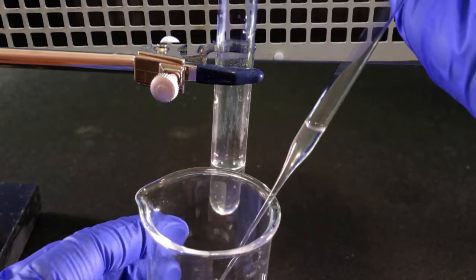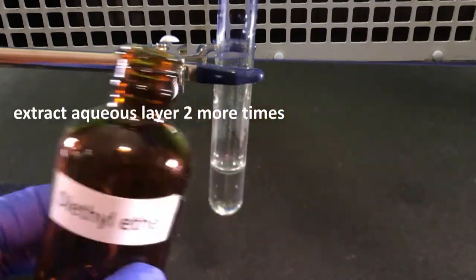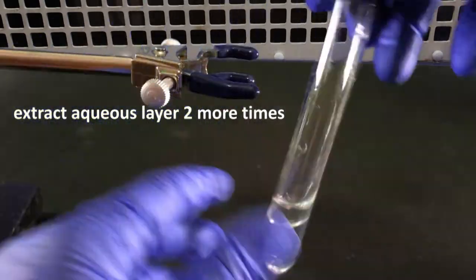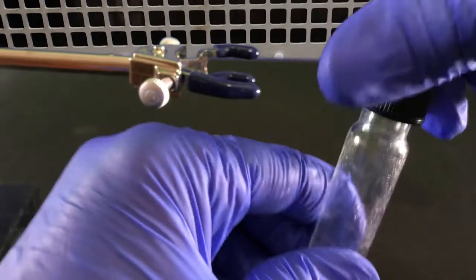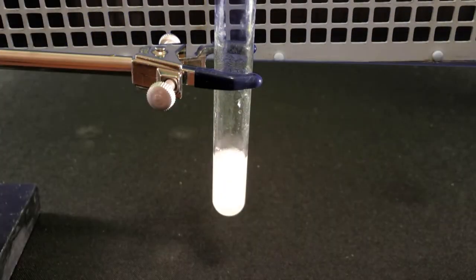To ensure that all of the product has been removed, you want to keep extracting the aqueous layer with diethyl ether. Do this 2 more times using 1 ml diethyl ether each time. After each addition, mix, vent, let separate, and remove the top organic layer. Combine this organic layer with the one previously removed.